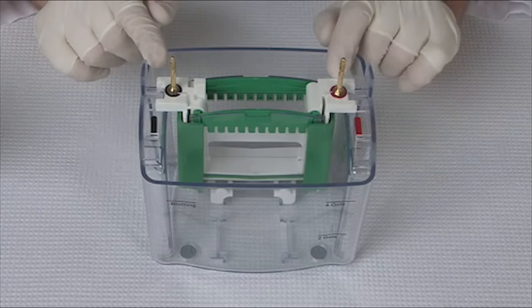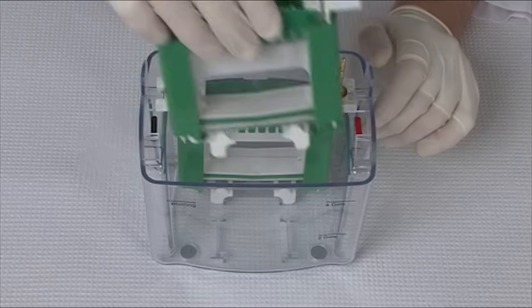If you are running three or four gels, you add the companion module and also put it in the TetraCell tank.